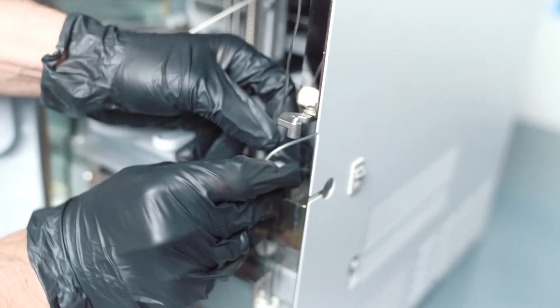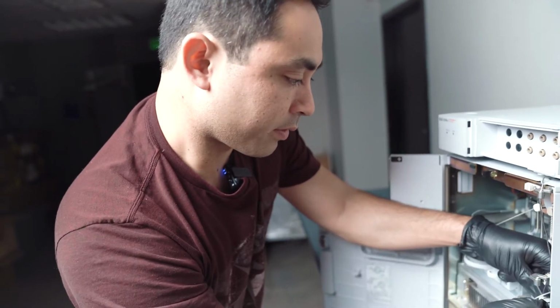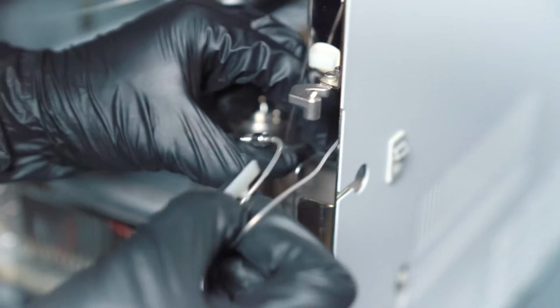Okay, so now that that's out. This is the part that's gonna get the dirtiest the fastest. Your injection loop is probably the piece of tubing that's gonna get gunked up the most often. So this is the most common piece of tubing you're gonna need to change. So watch for this, okay?